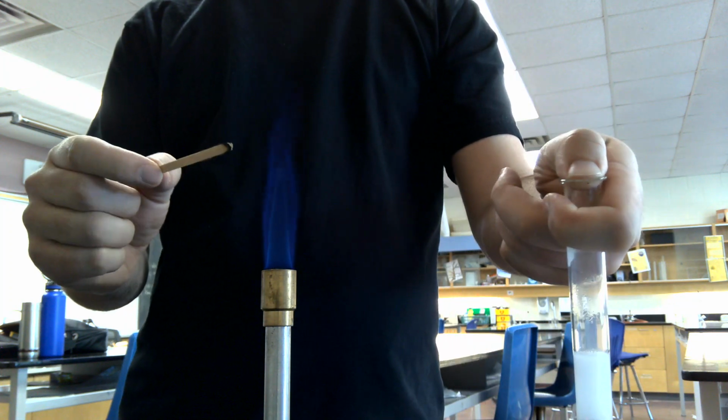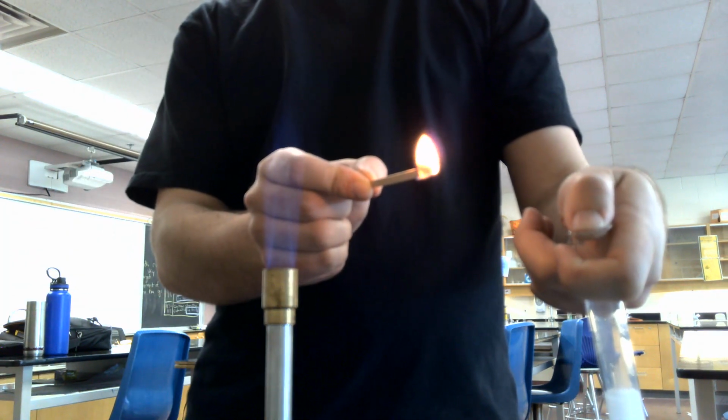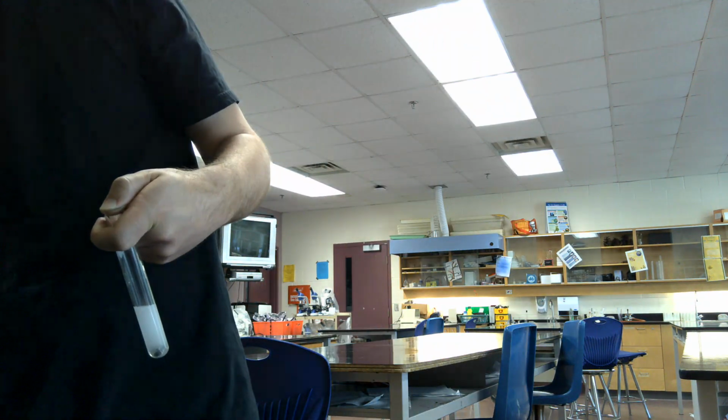So perhaps there might be enough built up again that I might be able to do this test one more time for you. Listen close. You might hear that nice little pop. Here we go. 3, 2, 1. Oof. So that is your burning splint test. Flames, we don't need it anymore. And we're going to set that aside. Actually, not yet. We're going to dump that out first and check it out.